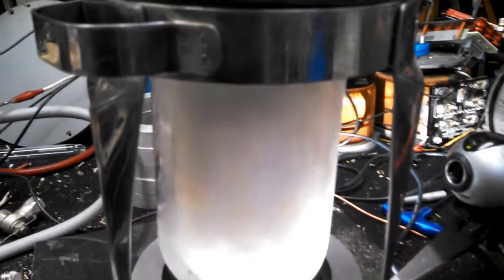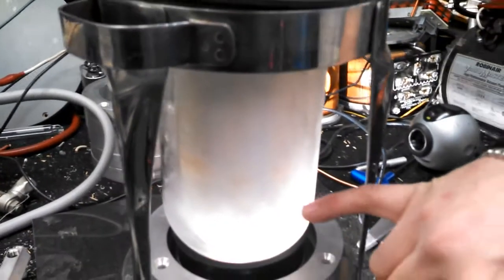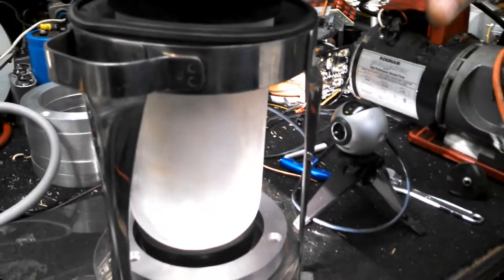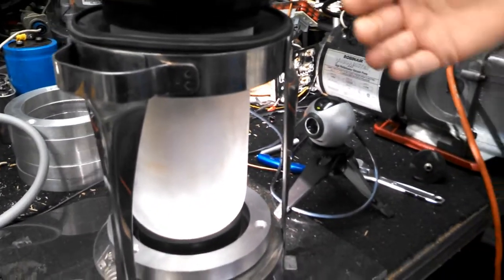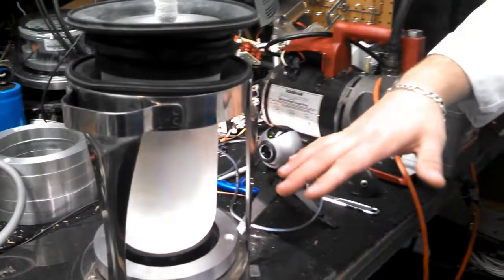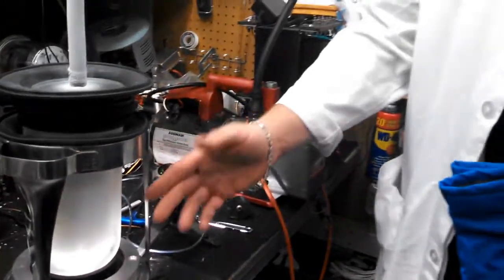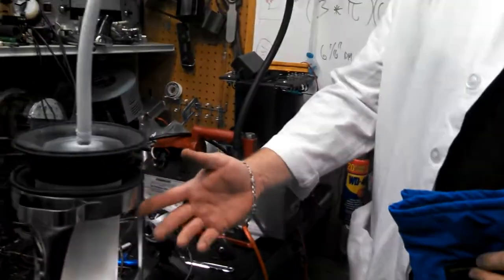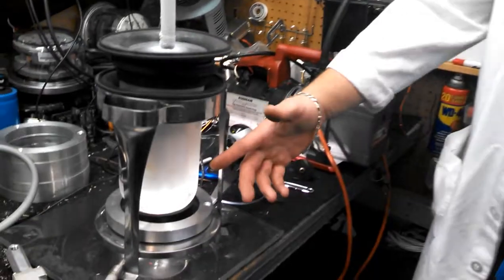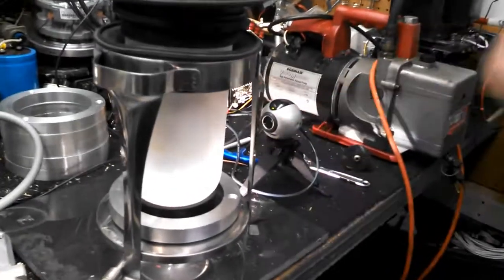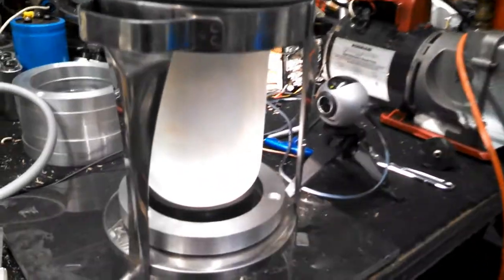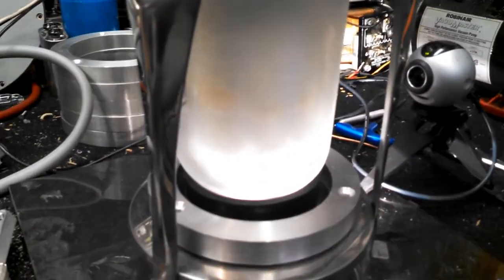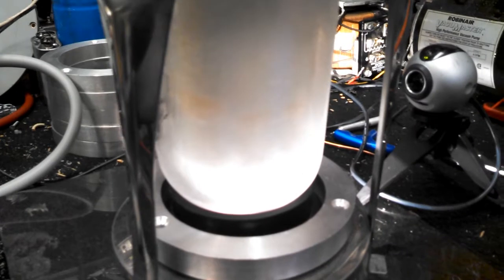So what we have here is a Dewar vessel connected up to a vacuum pump. I evaporated and cooled it down to about 63 degrees Kelvin. At that temperature it solidifies. So from here down to here is solid nitrogen or nitrogen ice, which is incredibly cold. Around 63.3 Kelvin.